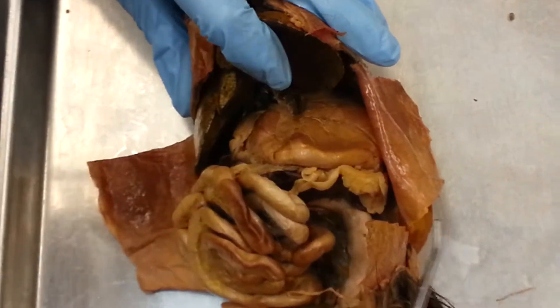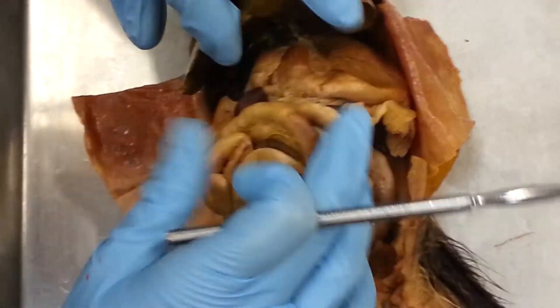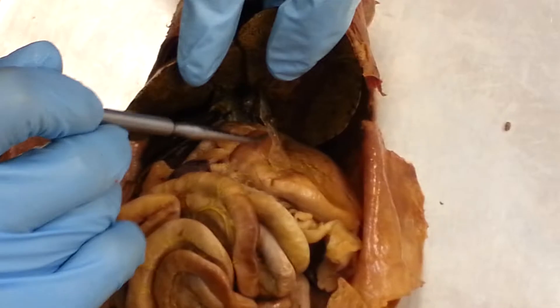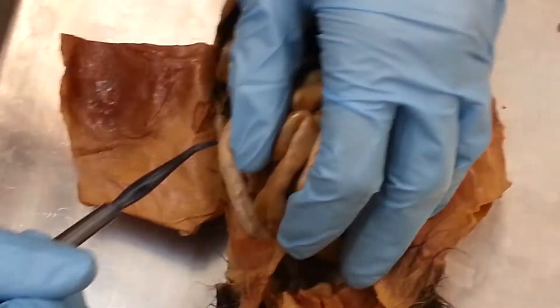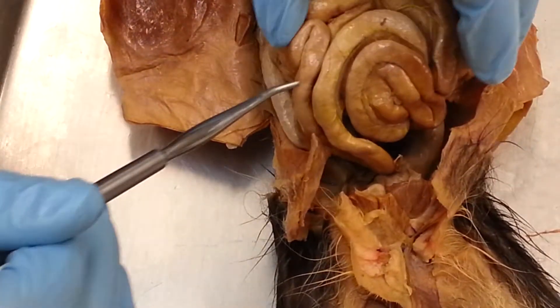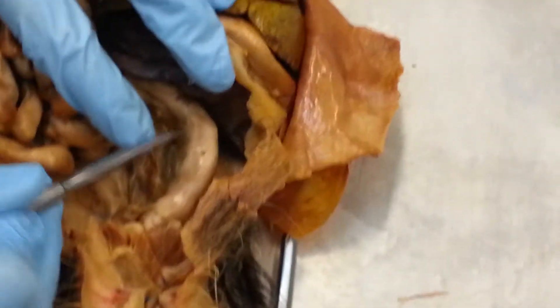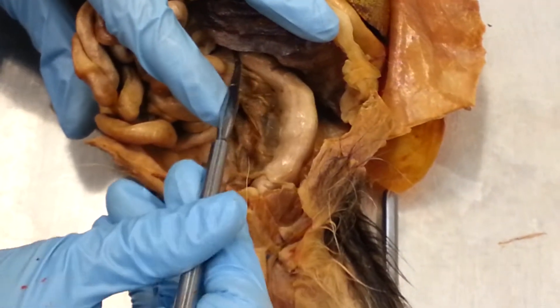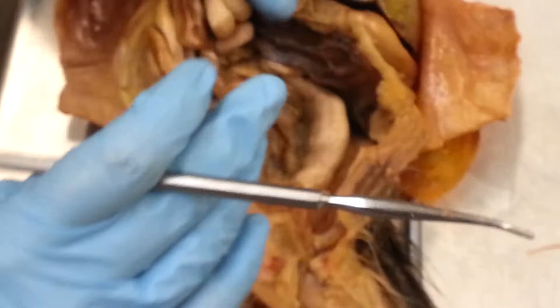The first part of the small intestine is the duodenum, so it's right here. Then the jejunum is the part after the duodenum. And then the ileum is the last part of the small intestine before the large intestine. This is the colon of the large intestine, and the cecum is the first part of the large intestine, but you can't really see it on here because we didn't remove everything.